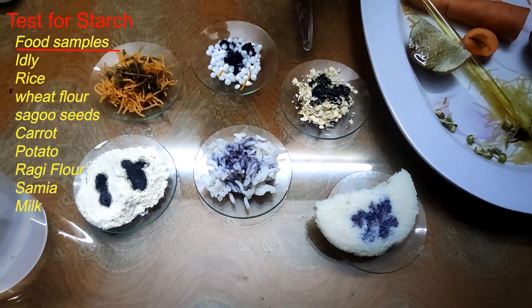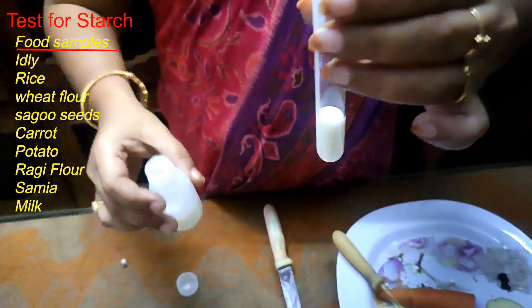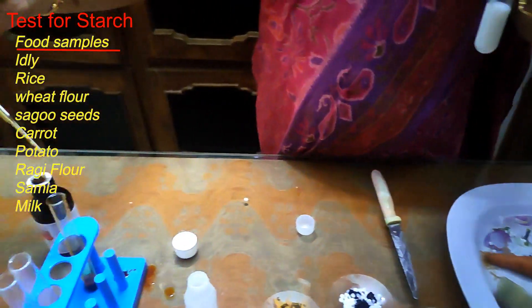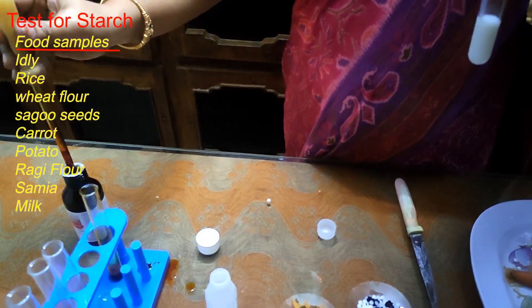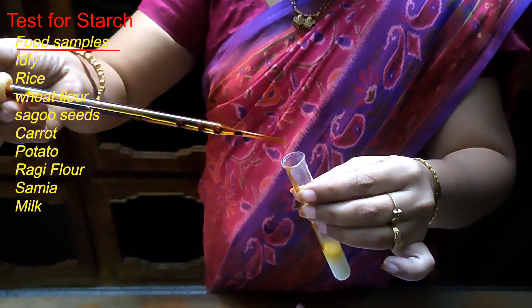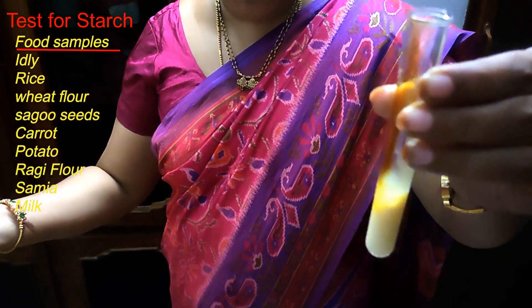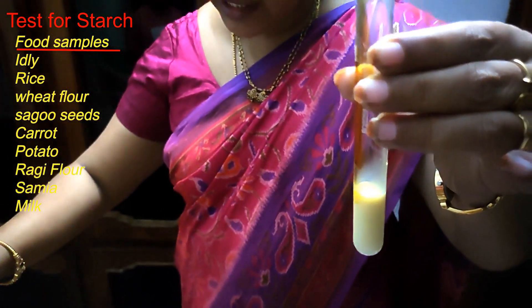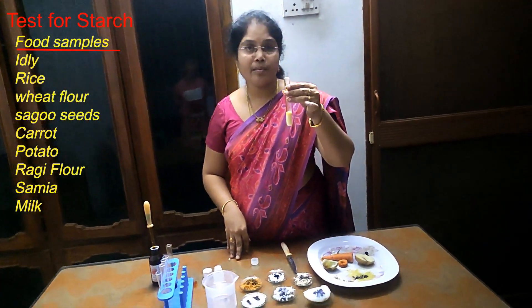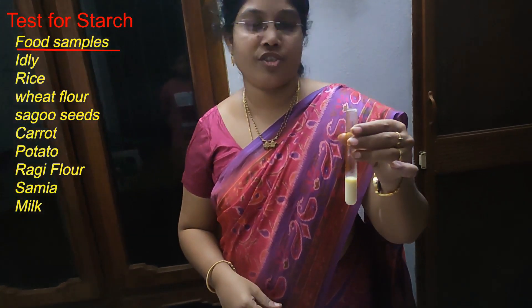One more food material we will check — that is milk. Pour the milk in a test tube, take some dilute iodine solution with the dropper, and add a few drops into the test tube. We can observe that the milk does not change to black or blue color. That means milk does not contain starch. Milk contains all the components, but it contains more protein. So milk contains more protein than starch.